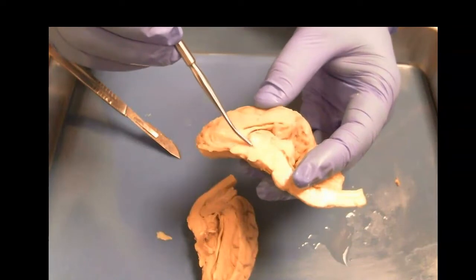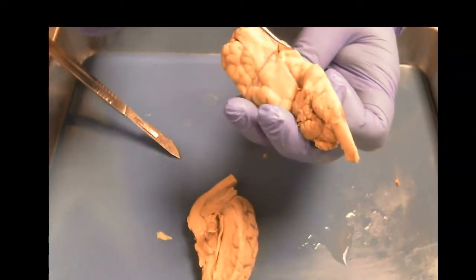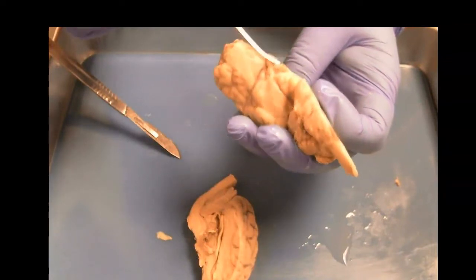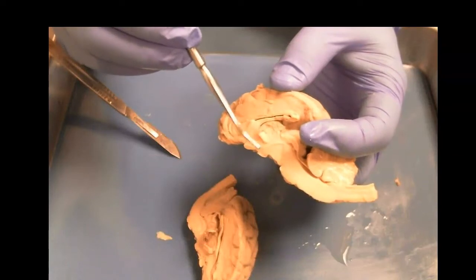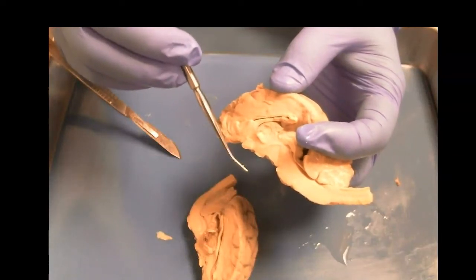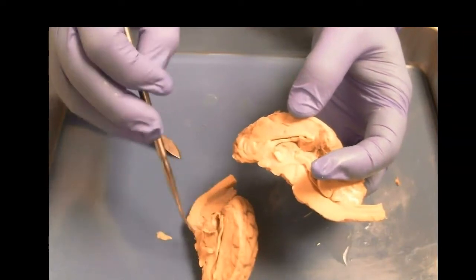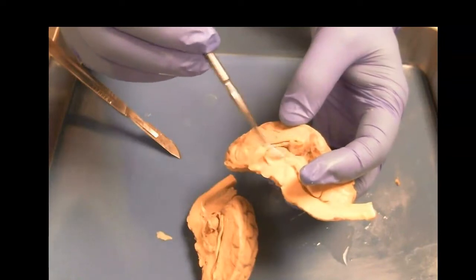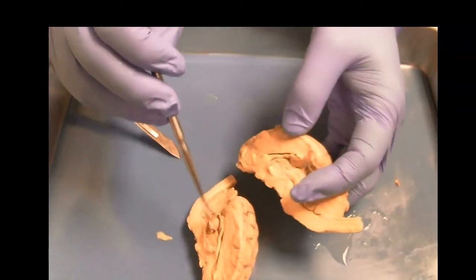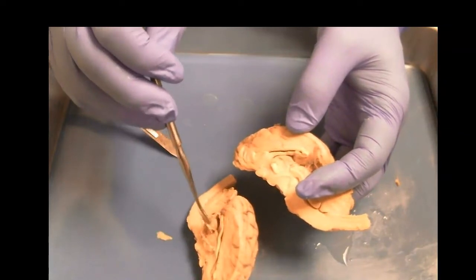Under the thalamus is the hypothalamus, and down here would be, which we don't see, the infundibulum, which connects the hypothalamus to the pituitary gland, right? So you've got the pineal gland, which was that little bump that we saw on the other hemisphere. It's connected to it now here, and this produces melatonin and hormones.